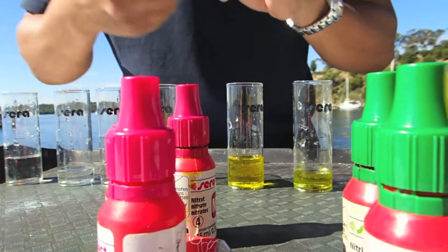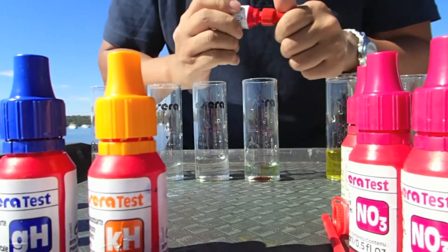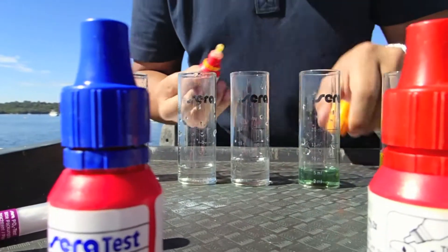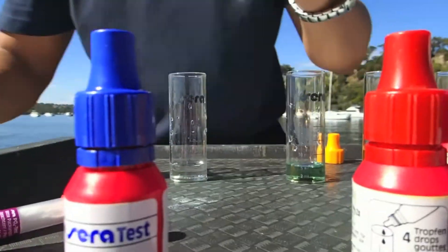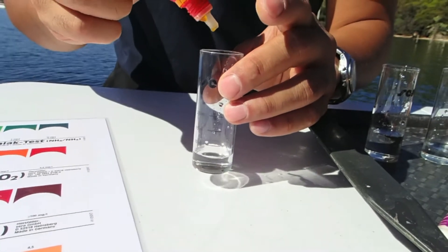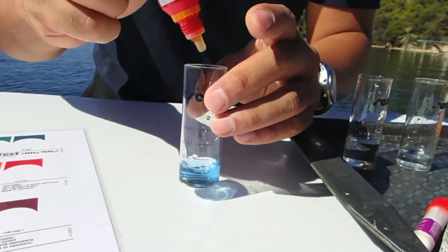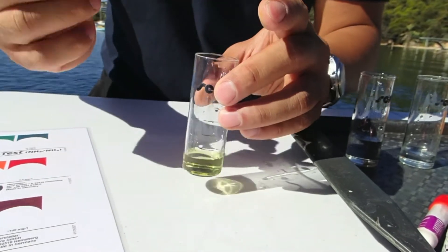Now we will move on to the pH, which is just 4 drops. And the KH test, which is pretty much a titration method. So basically what we're going to do is hold it against the white background here. We're counting the number of drops it takes for the solution to turn back to the colour that's coming out of the bottle. It comes out as orange. That's 1, 2, 3, 4. So it's taking 4 drops, so the alkalinity is going to be 4 degrees of hardness.